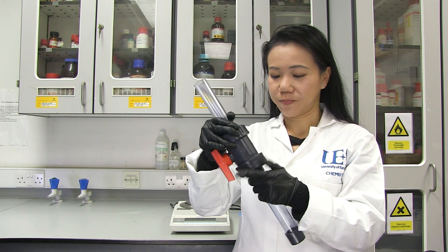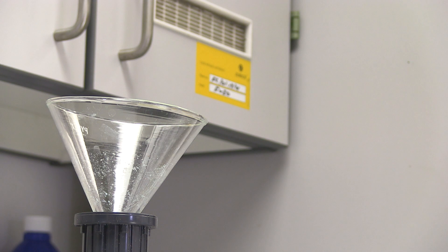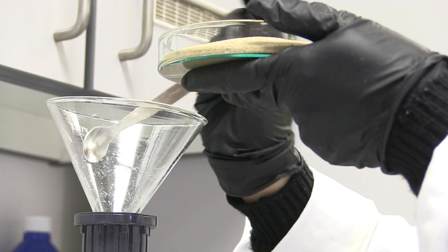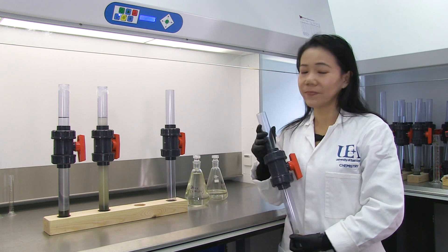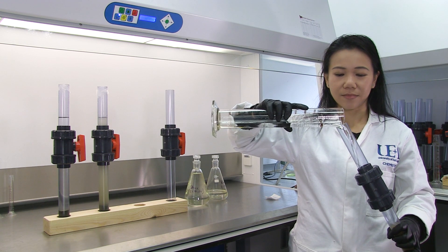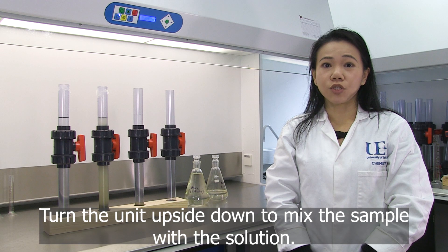Unscrew the lower tube. After you have weighed your sample, pour in a suitable density solution, for example zinc chloride.